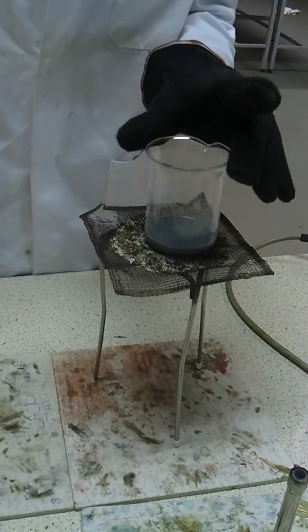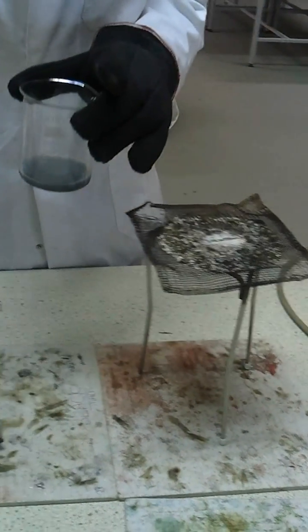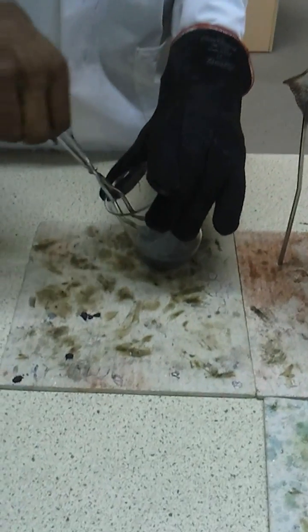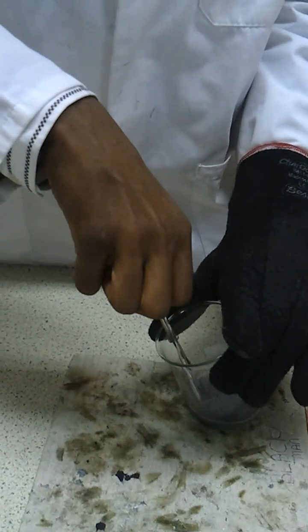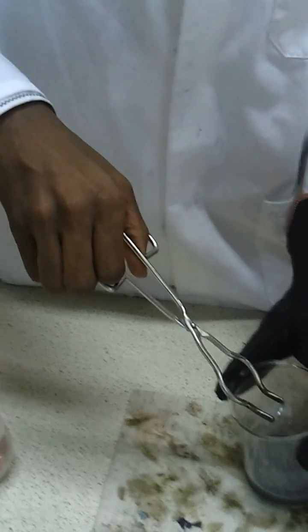Okay, using oven gloves - that's a really important bit. And on the side and inside, this is a silver coin.